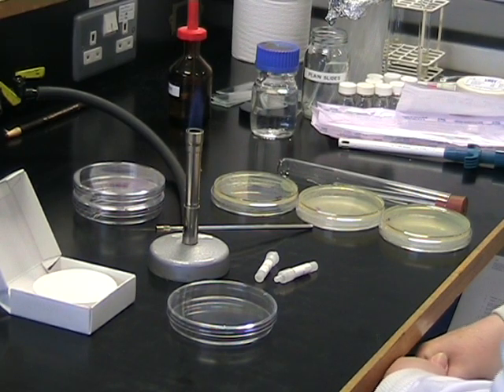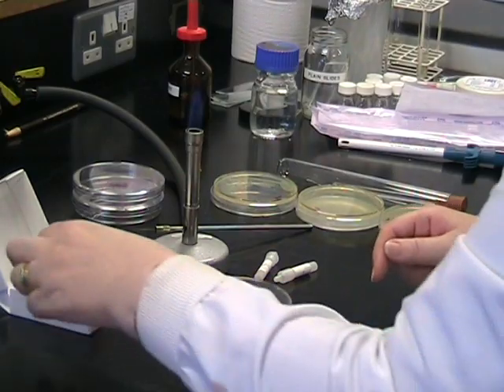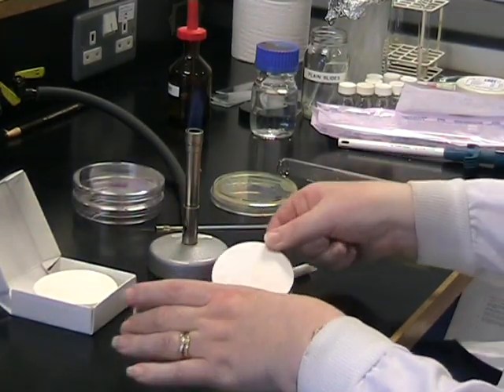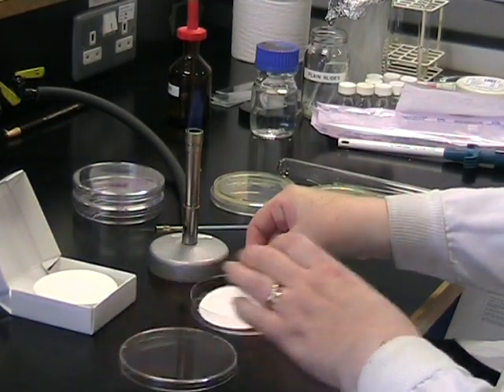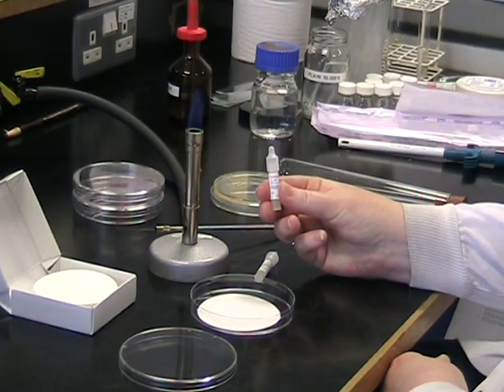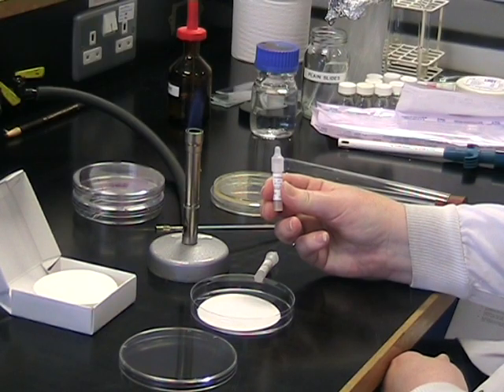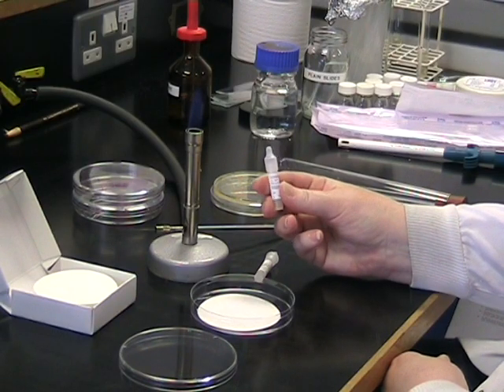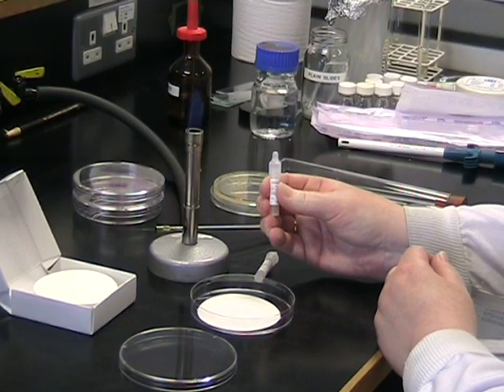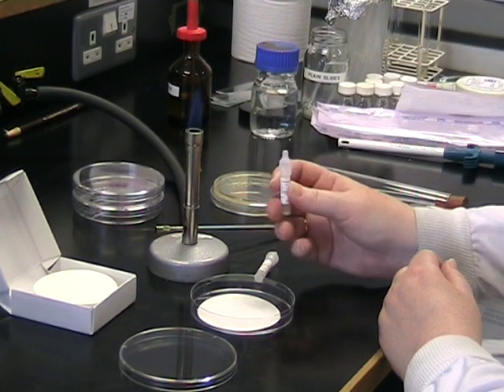I'm now going to show you an oxidase test. First, place a piece of filter paper into an empty Petri dish. The oxidase reagent is provided in a plastic dropping tube which contains a glass vial. Crush the plastic tube to break the glass vial inside. Place some drops of the reagent onto the filter paper.